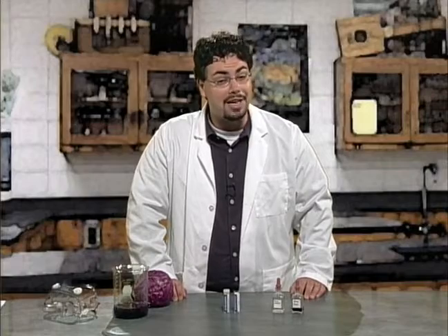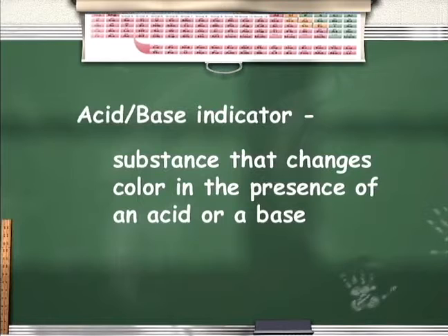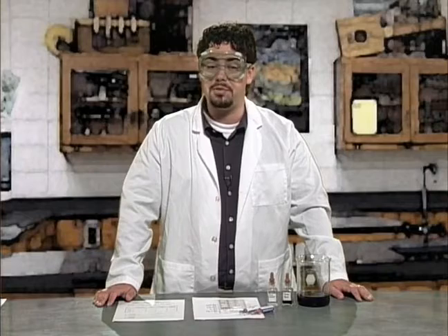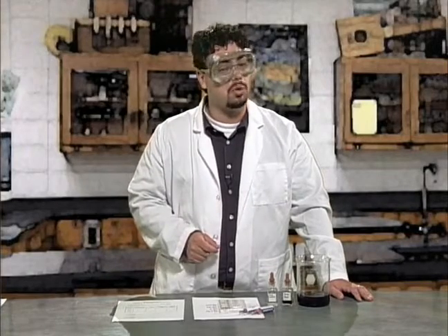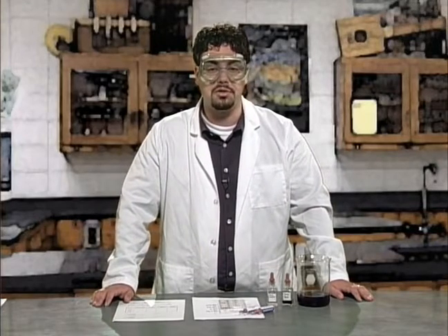To really understand what we are talking about, you need a definition of acid-base indicators. An acid-base indicator is a substance that changes color depending on whether it is in the presence of an acid or a base. There are many indicators available to help us determine if a substance is an acid or a base. Different indicators work best in different pH ranges, but we'll get into that more shortly. For now, let's do a little experiment to illustrate the use of indicators.